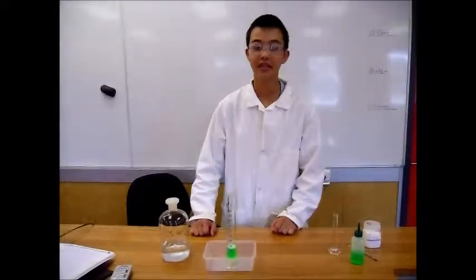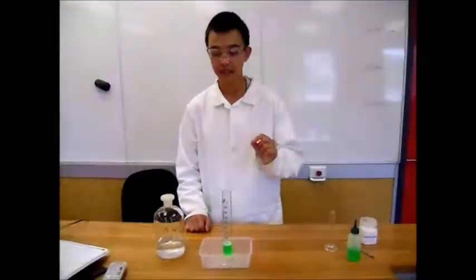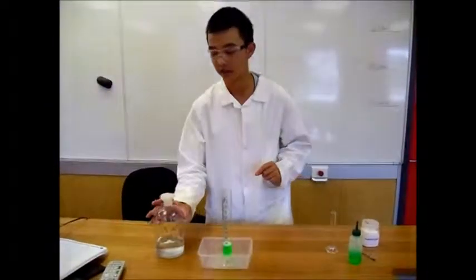Hello. Today we will be investigating the catalytic decomposition of hydrogen peroxide.